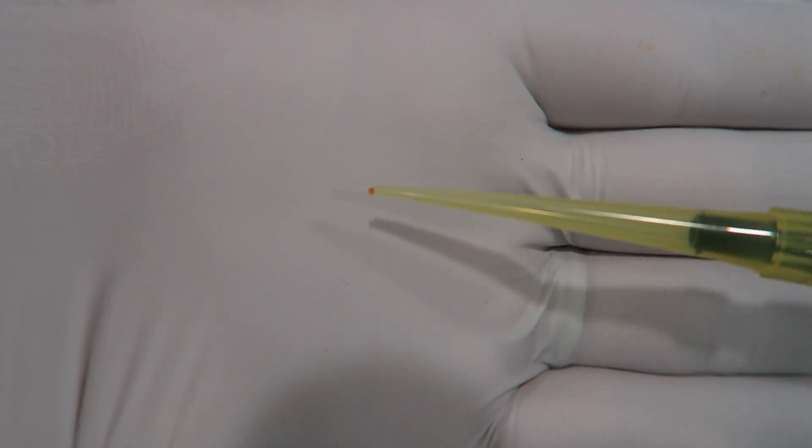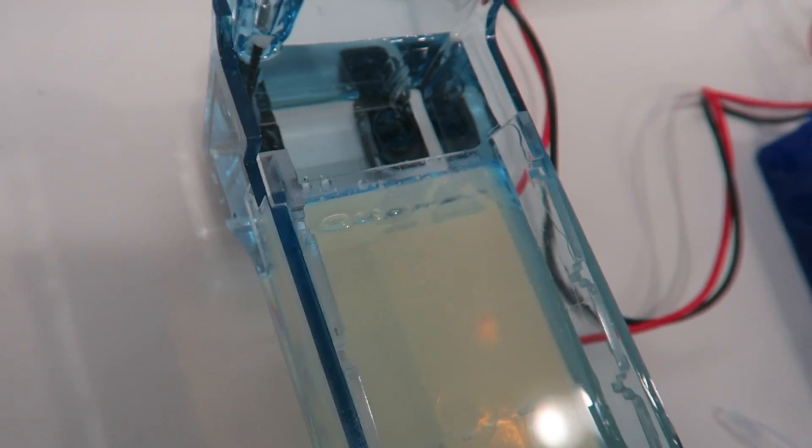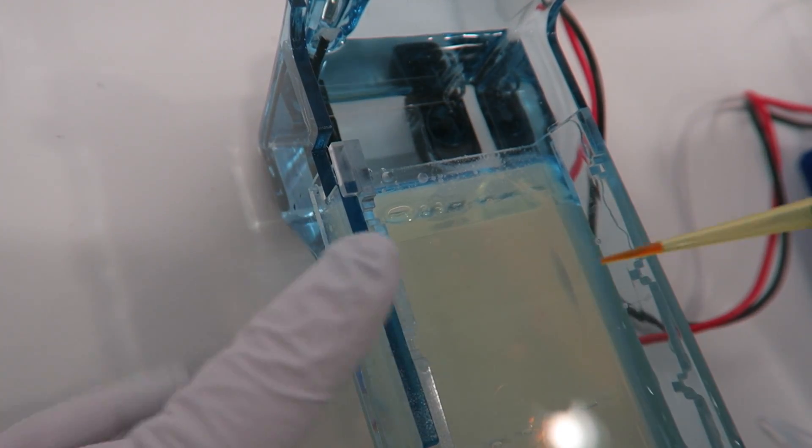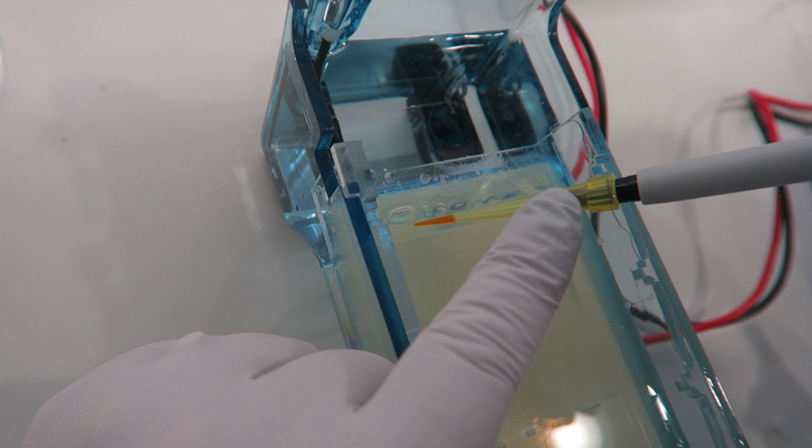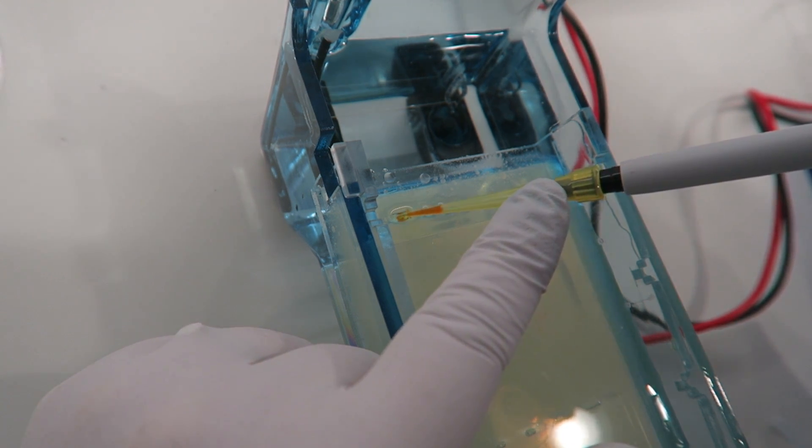We are not going to reuse things that will lead to cross-contamination of our samples. After your sample is mixed with the dye you can then very carefully and slowly pipette it into the well.